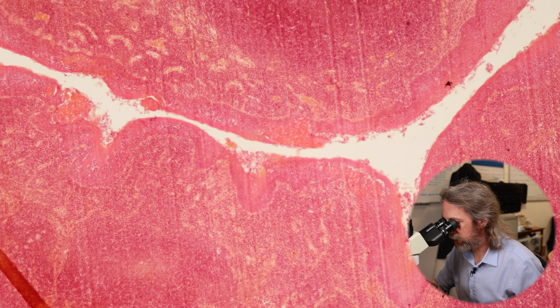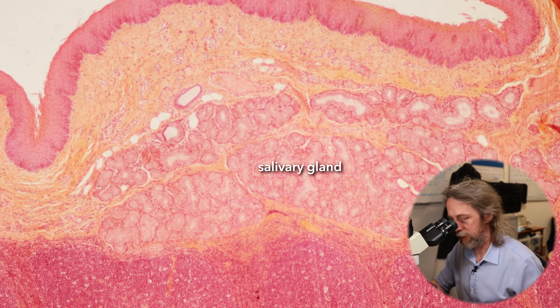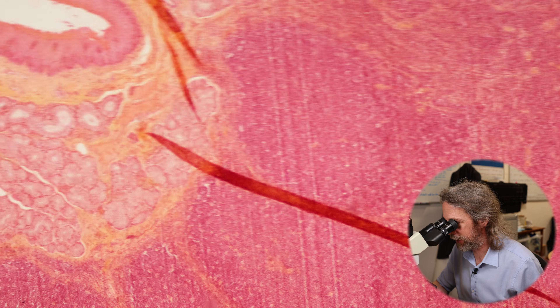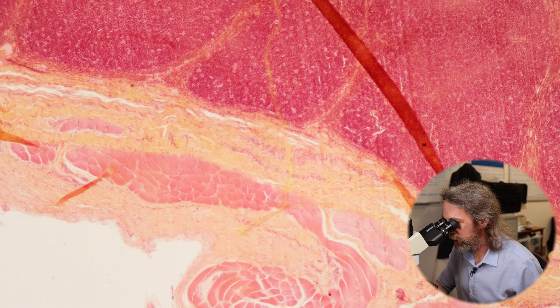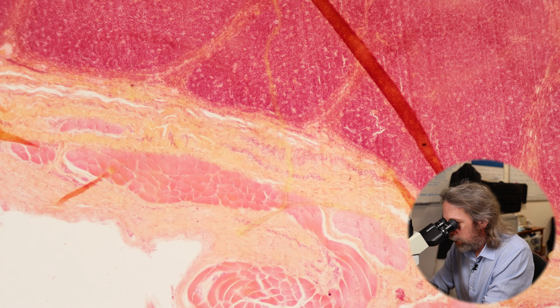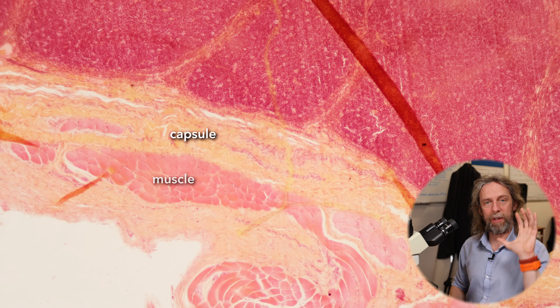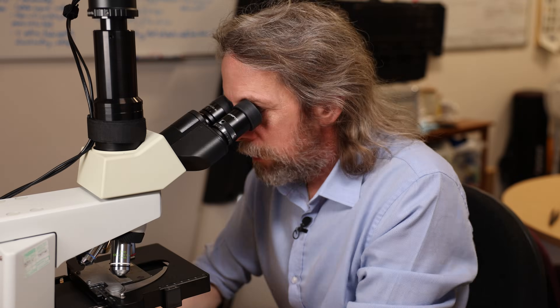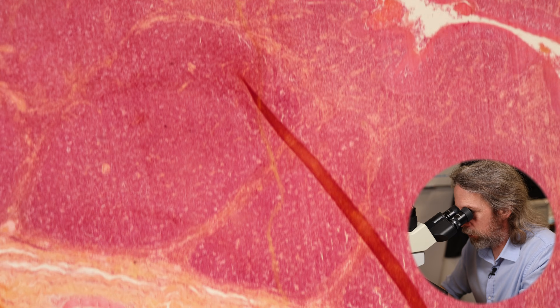On one side of the tonsil we have the epithelium. There's also some glandular tissue in there, which is the nature of where the tonsil sits — we can ignore that. On the other side of the tonsil we've got connective tissue and a bit of a capsule, so the tonsil is partly encapsulated and partly covered by epithelium.